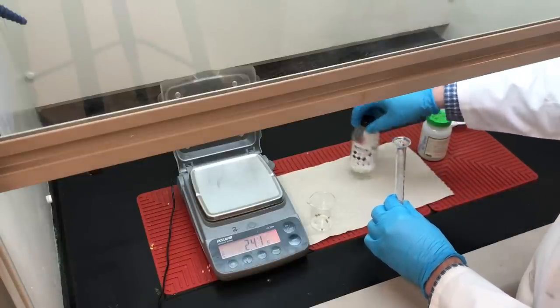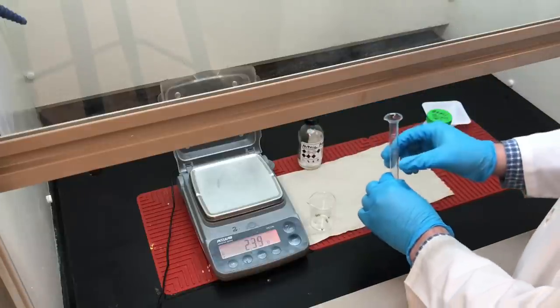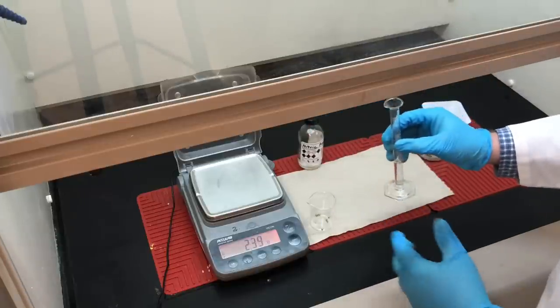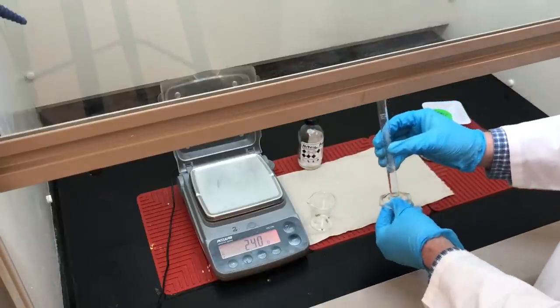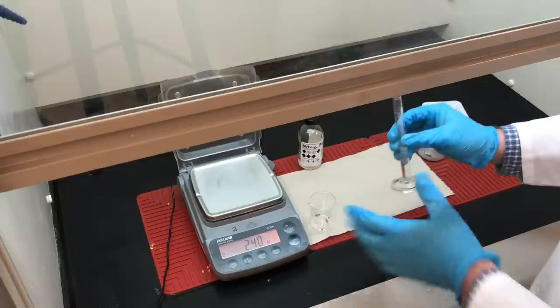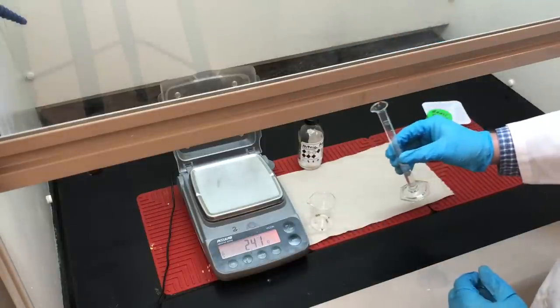We're doing this part of the experiment in the fume hood, which is where you should handle concentrated acids at all times. The fume hood is taking away any dangerous vapors.